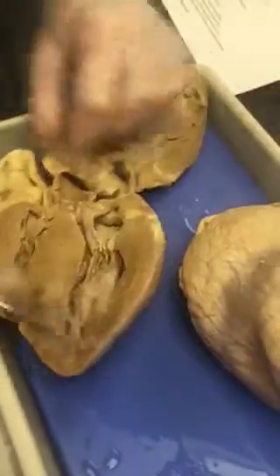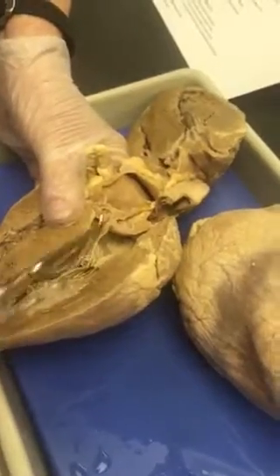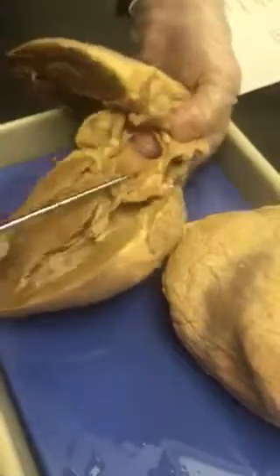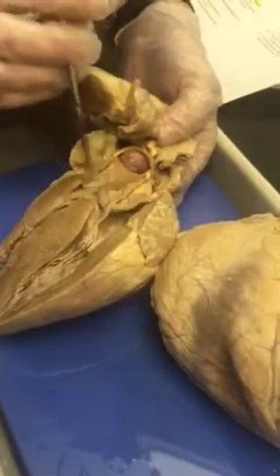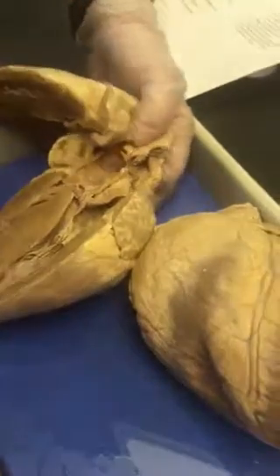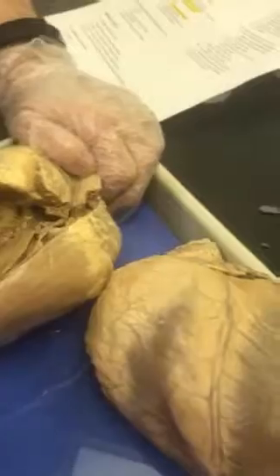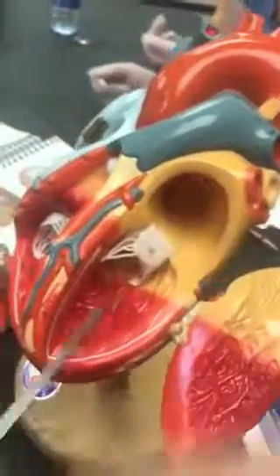The aortic semilunar valve going from the left ventricle into the aorta. Okay, here. Okay, there's aortic semilunar valve. You won't ask that on this heart though, will you? Might, it's right there. The one I can't ask on this heart is the pulmonary semilunar valve. It's easily seen here, whereas the aortic semilunar valve is real hard to see. Back there. It's way up under there.